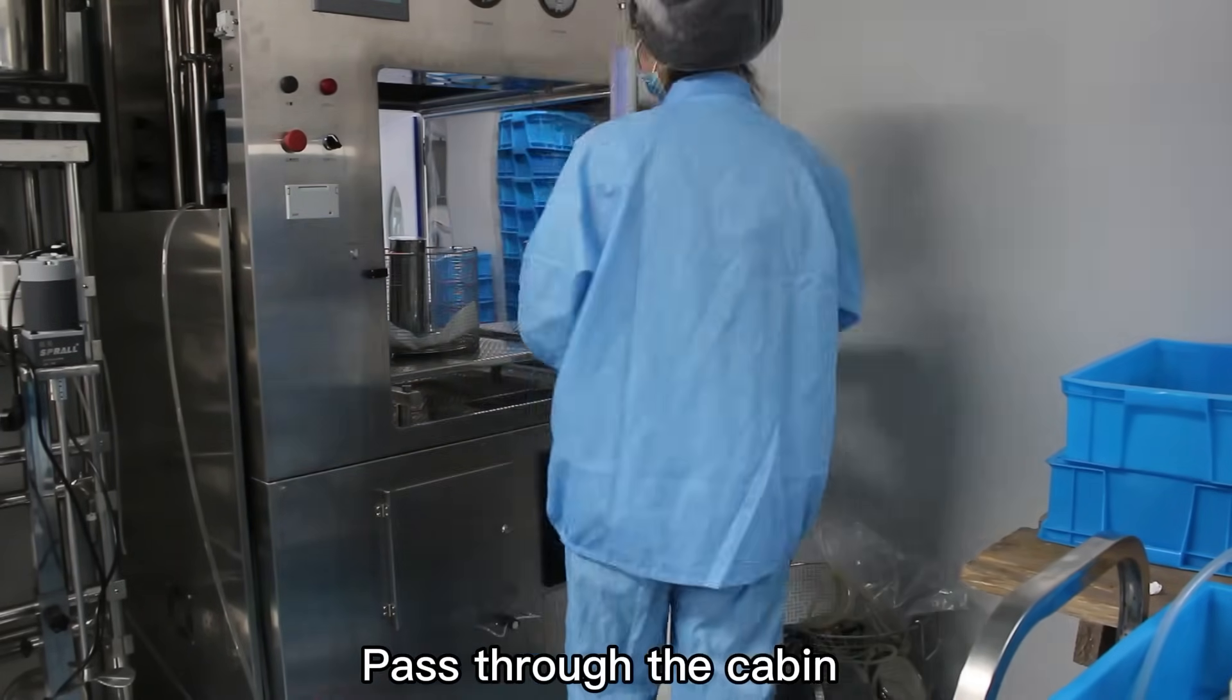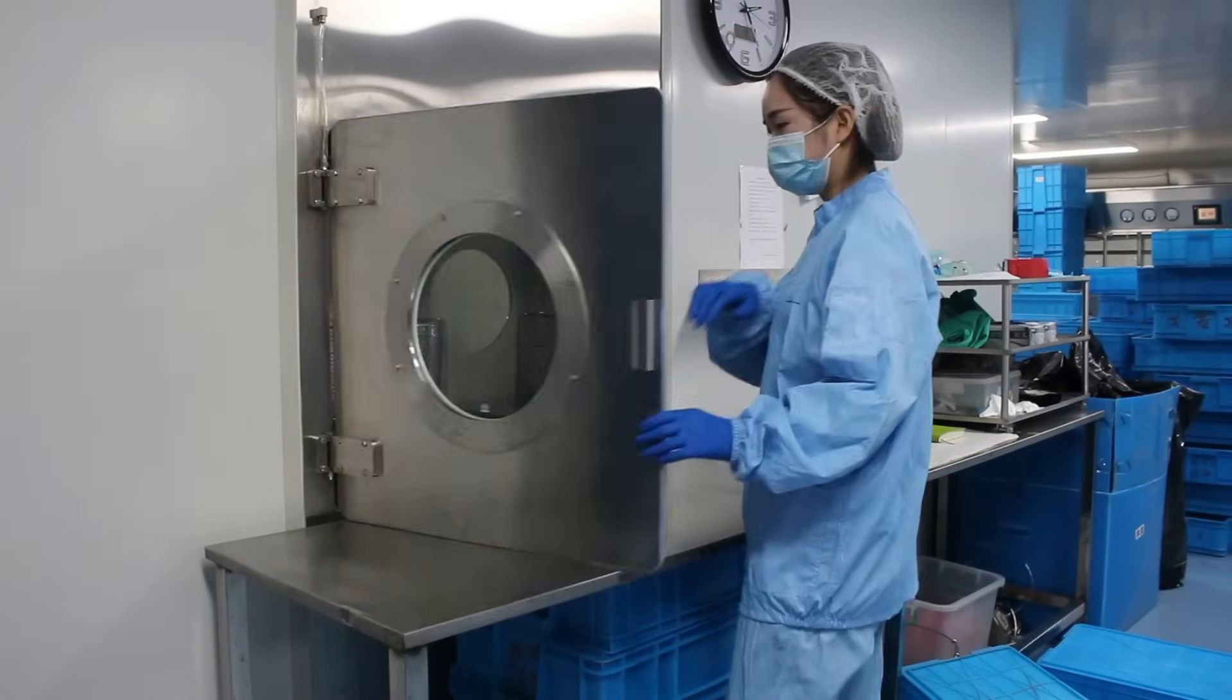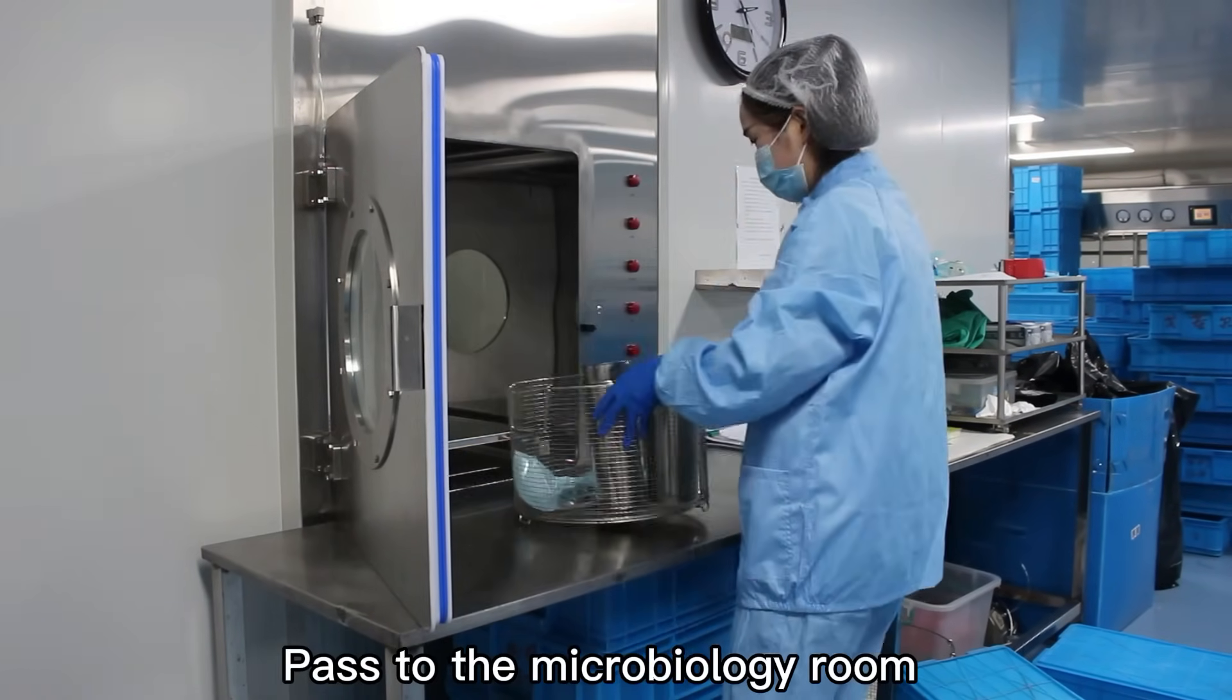Pass through the cabin. Pass to the microbiology room.